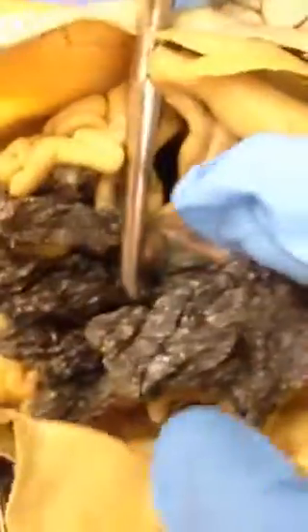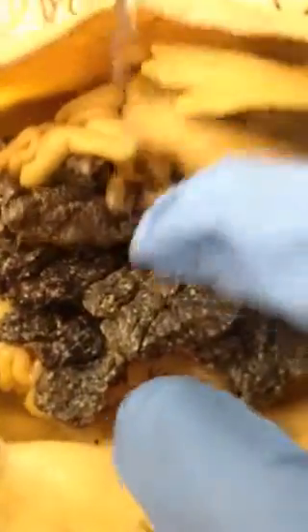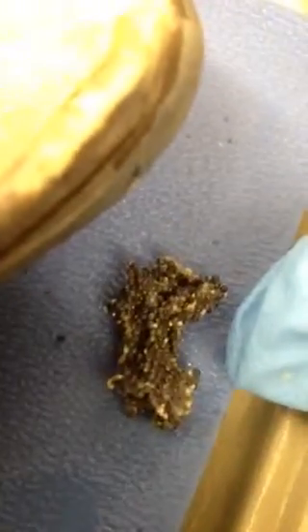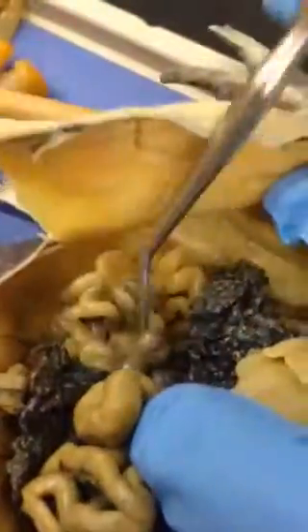All this black mushy stuff right here is the ovary, and inside of it you have eggs, which you can see right here. This tube is the oviduct. This right here is a lung.